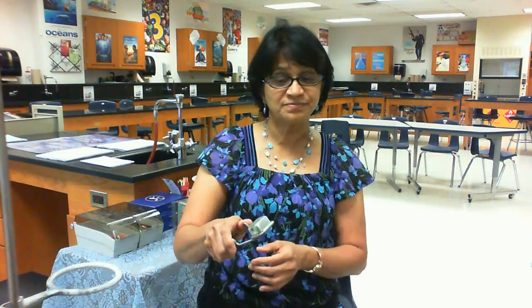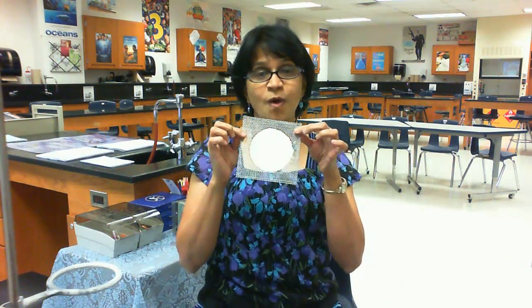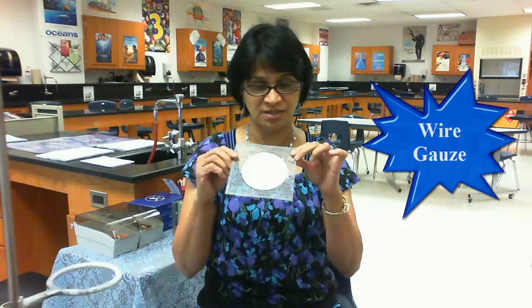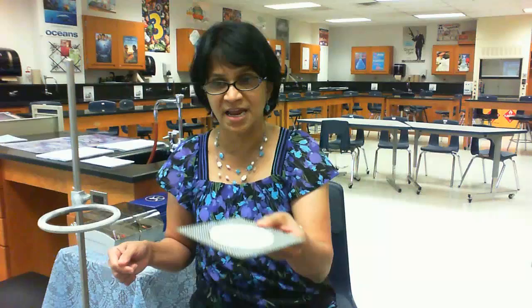We talked about the burner and flame — how are we going to light it? This is the striker, and we use it for lighting the flame of the burner. This is a wire gauze which helps the flame to spread. I'll show you the stand — this is a stand with a ring stand, and on top of the ring stand we keep the wire gauze.